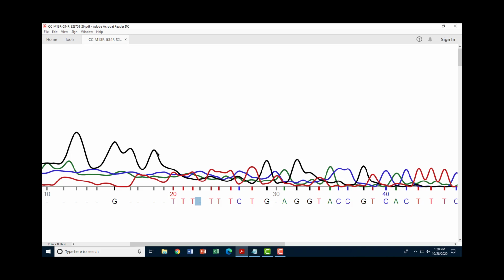We have this big black trace of guanine, and it peaked out right here. But then it went down and didn't really peak back up again. Even though it's the strongest signal, it appears to be on the downslope. And so I wouldn't have real confidence that that's correct. What I might do then instead is look for somewhere where I see a signal increase at that position. And I see a signal increase right here. So I might go ahead and plug in cytosine in that position. Even though the guanine has a higher intensity, it's clearly on the downslope from its previous marker right here.